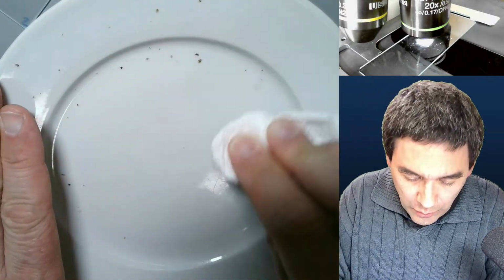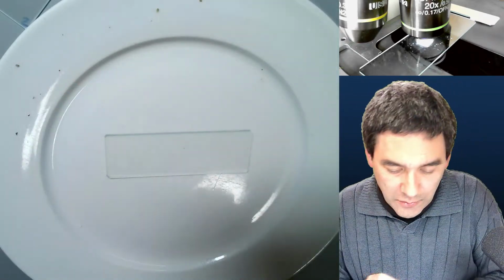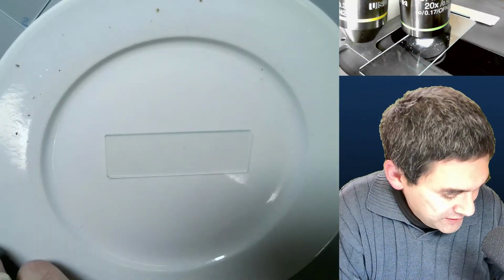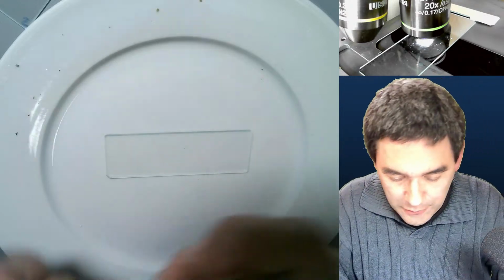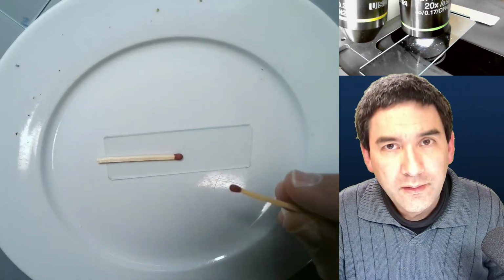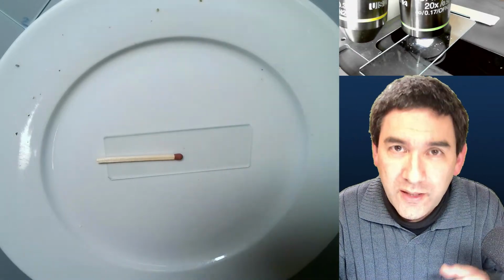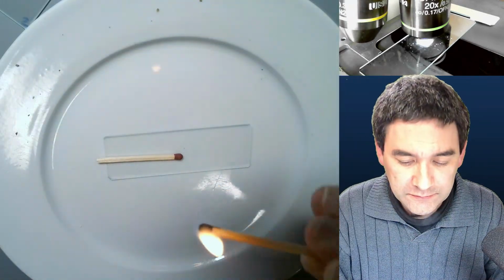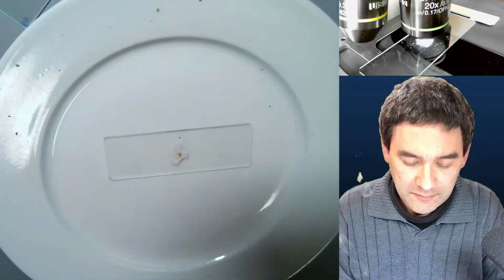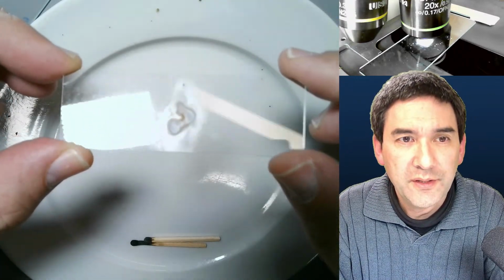Let's wipe the water here. There's still some of the pepper on the plate. What we now do is put a match on the slide. I want to put the alcohol away as well, for obvious reasons. I'm going to light the match now from the top, and this will cause vapors to form, and those vapors will crystallize on the cold microscope slide, and we can also observe this under the microscope. Okay, that's it. We see that there is some kind of a deposit here. Let's put this under the microscope.